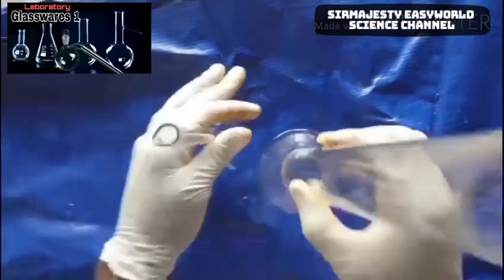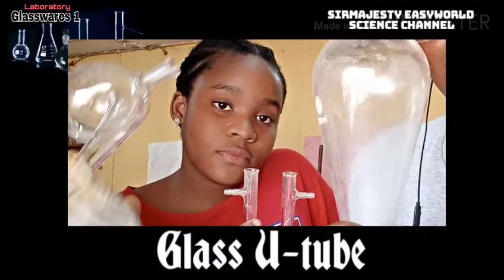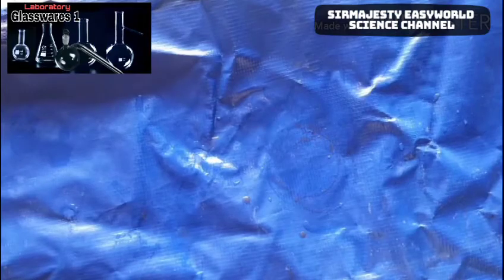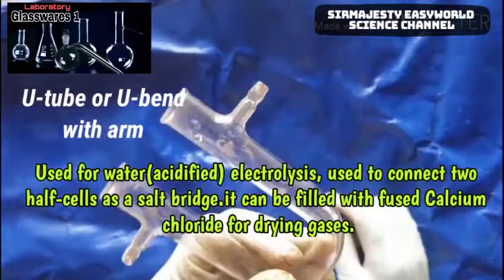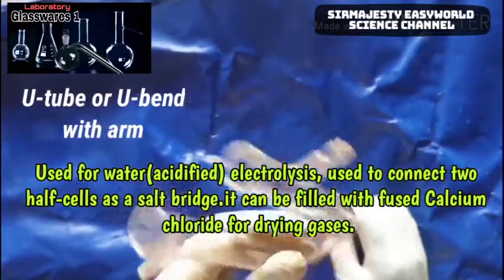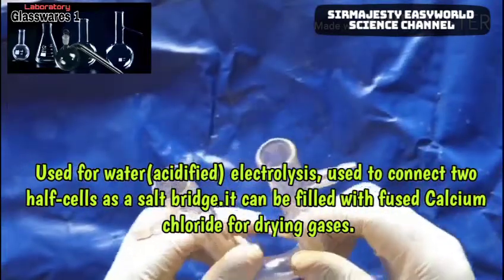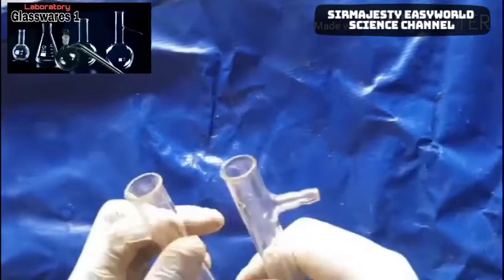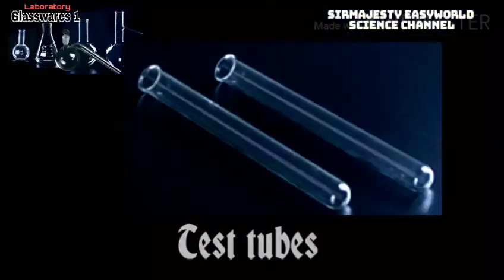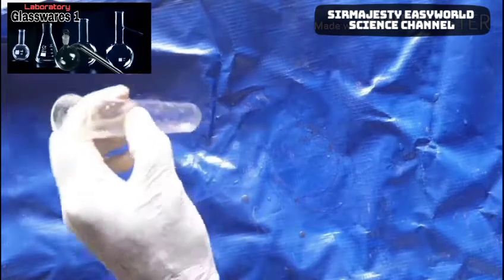You can see the various uses on screen. You can commonly apply it to the drying of some gases, or use it as a salt bridge to complete two half-cells, among other uses. Next we have the most common glassware — the test tube.